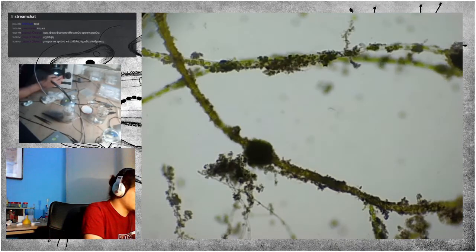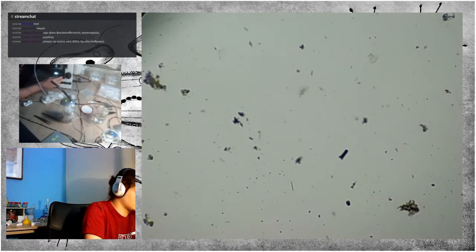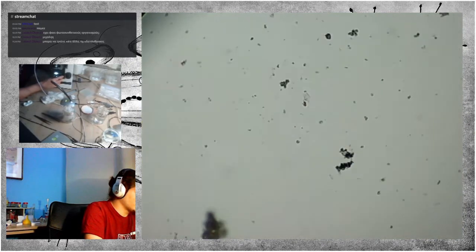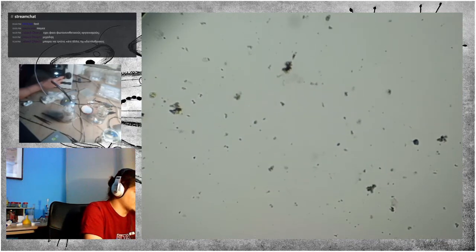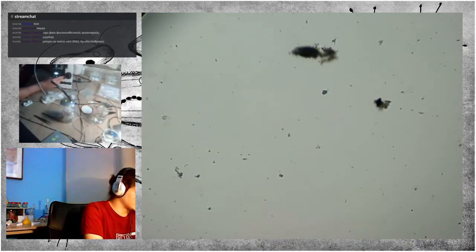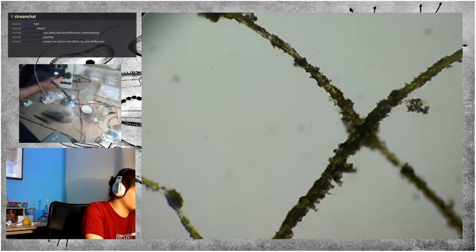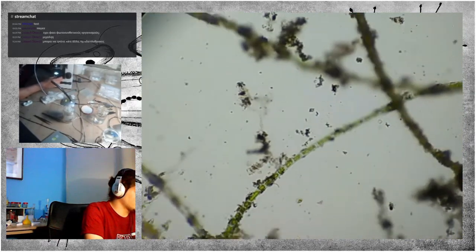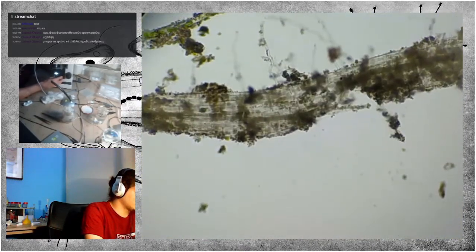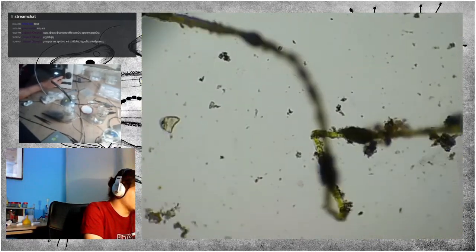Now, this slide seems to be quite disappointing. Another thing in microscopy is that you never know what you'll find. You can expect to find some things sometimes, but for example, if you see green stuff, obviously you will find algae. In sediment, it is very possible that you'll find little worms.